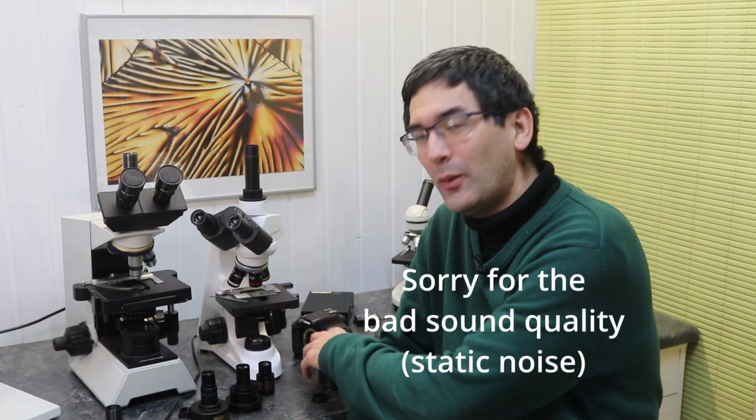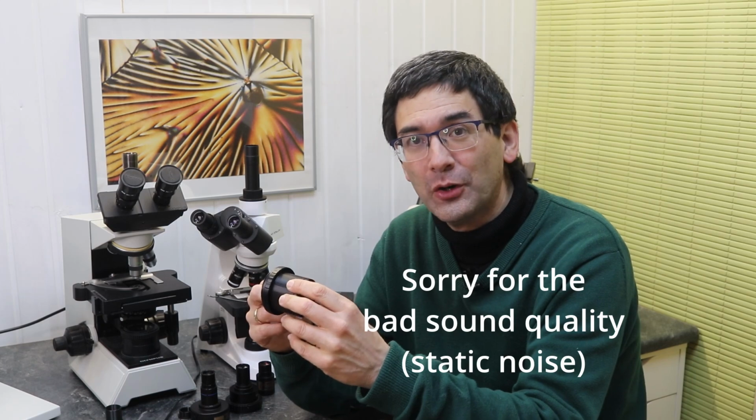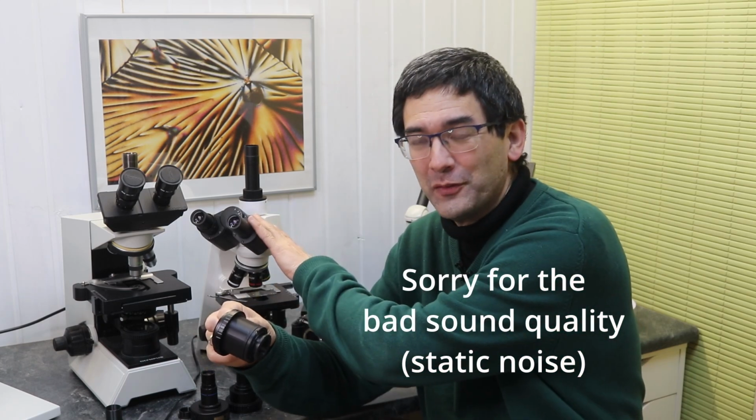So hi, Microbe Hunter here, and today in this video I'd like to show you how I 3D printed and made this DSLR camera adapter for my microscope over here.